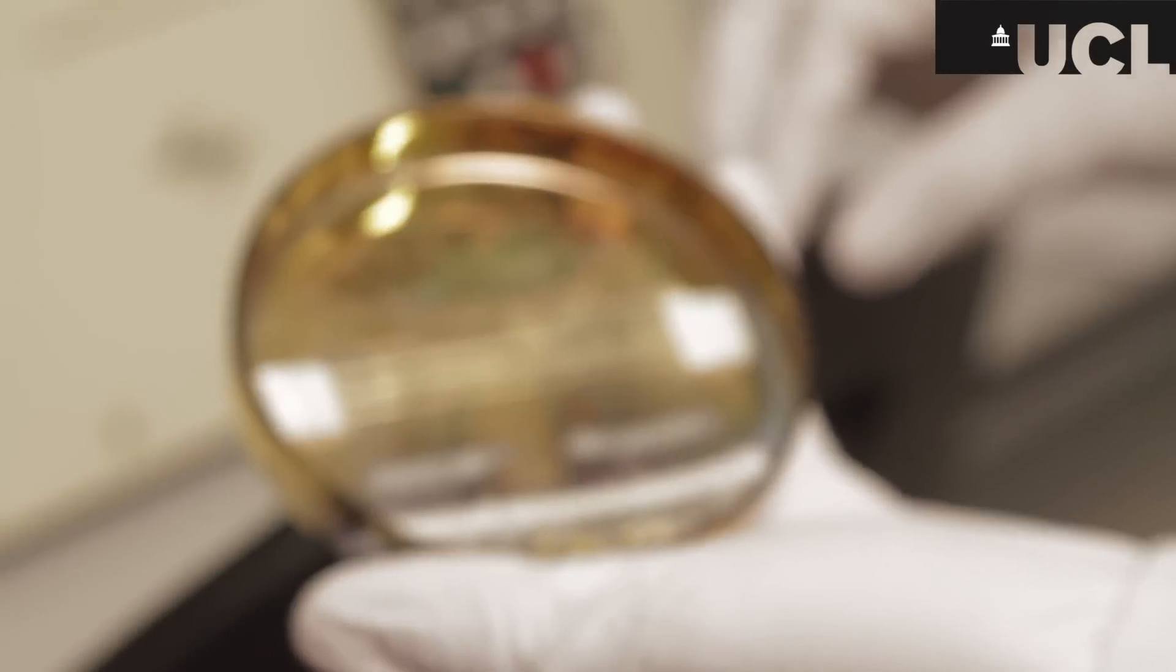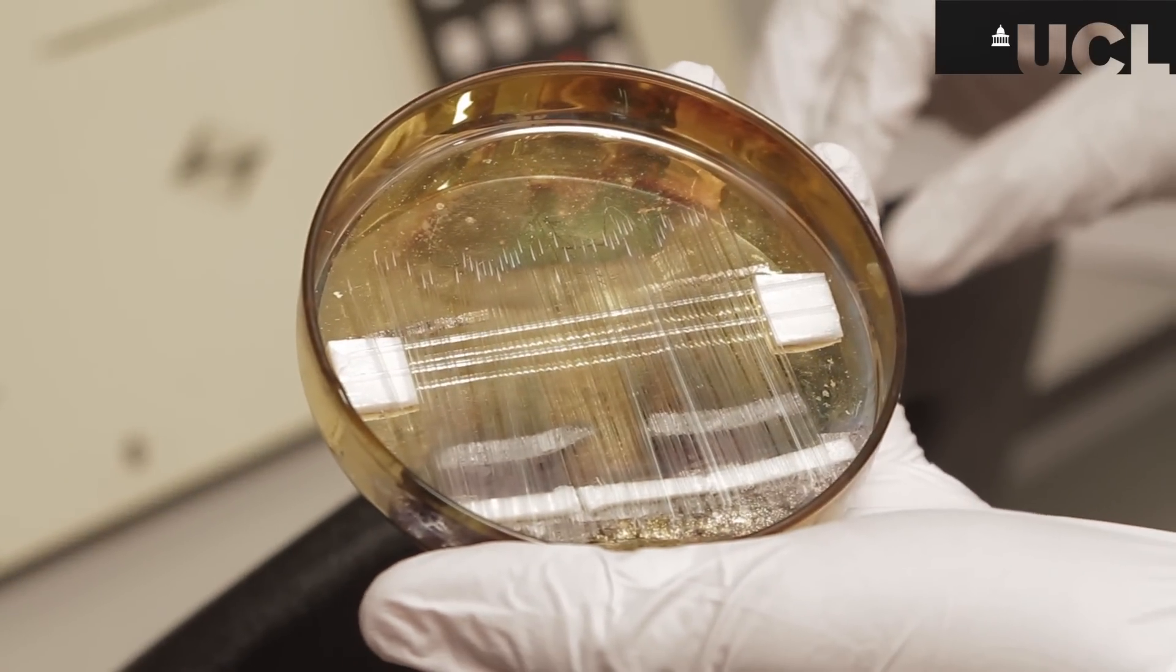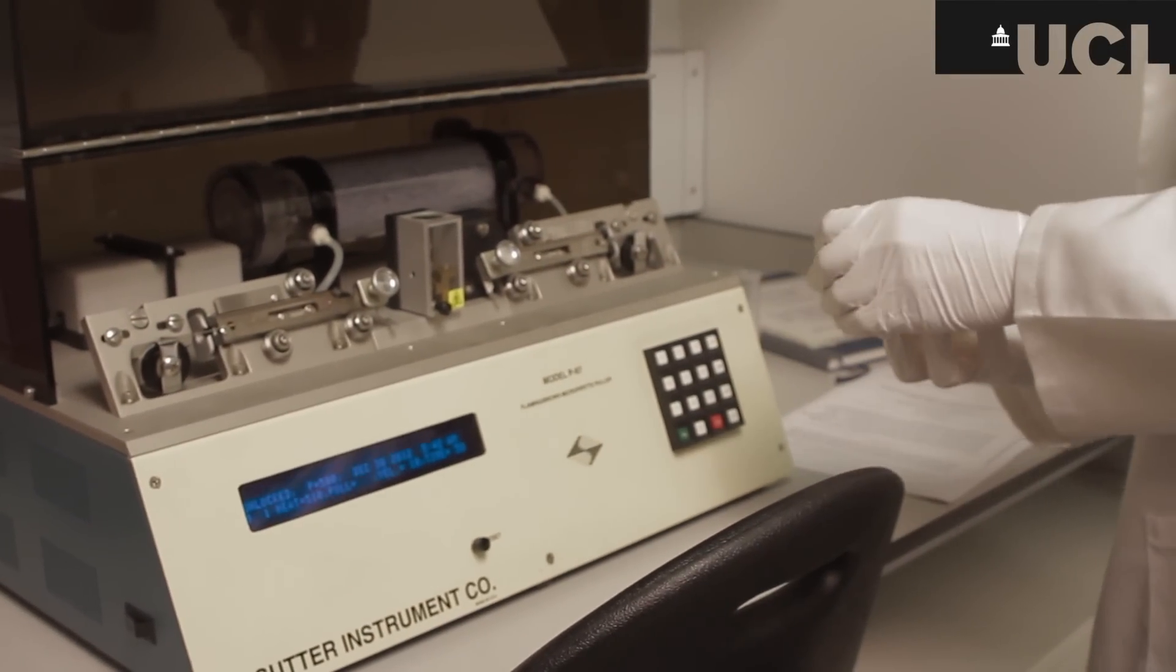That's the finished glass plate with all the capillary tubes. They can now be taken to be gold coated.